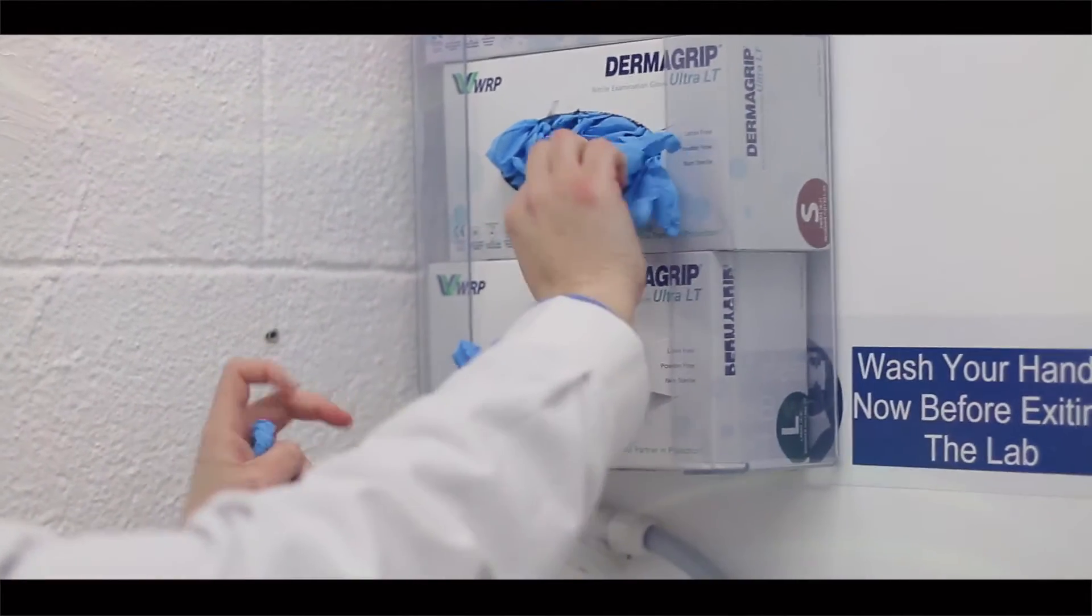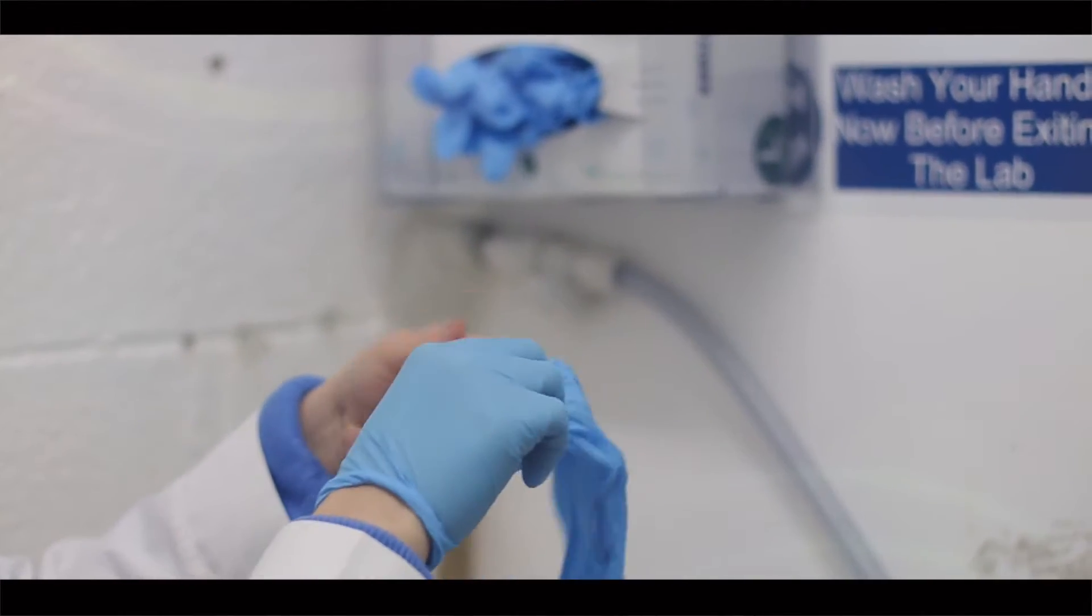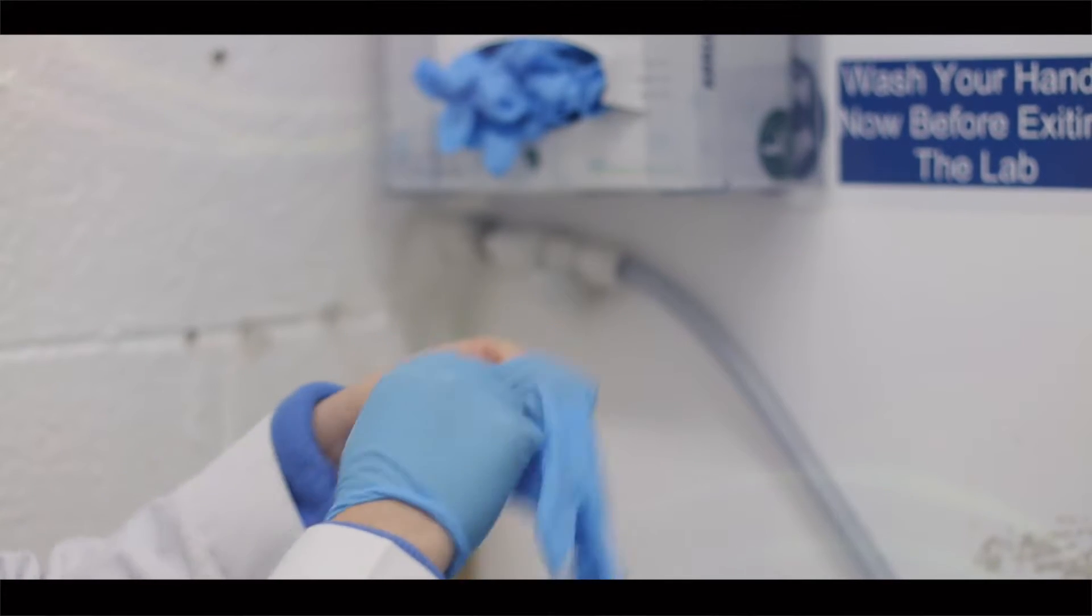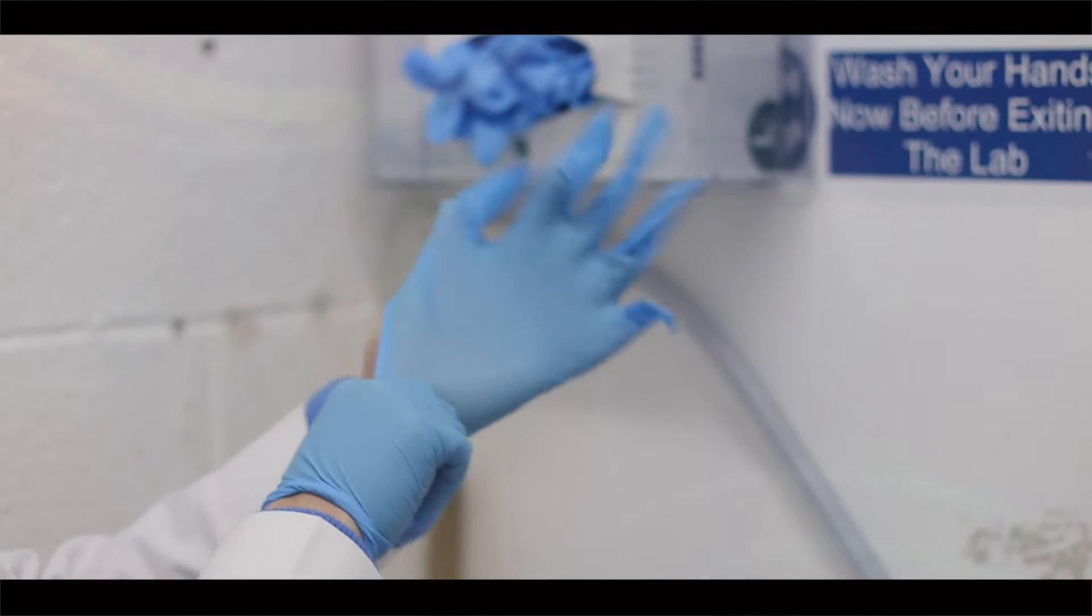While working in a microbiology lab, we will come in contact with many hazardous substances like pathogenic bacterial cultures. That's why wearing gloves is advisable.